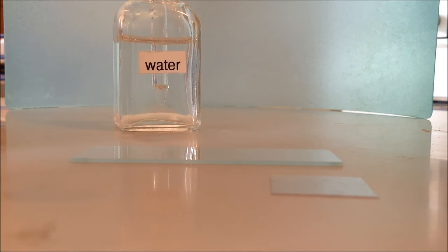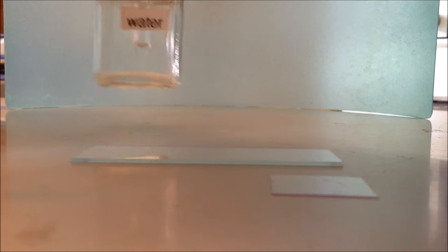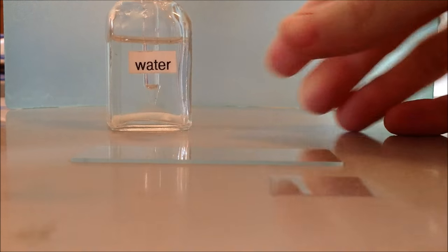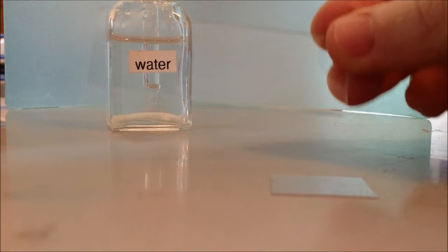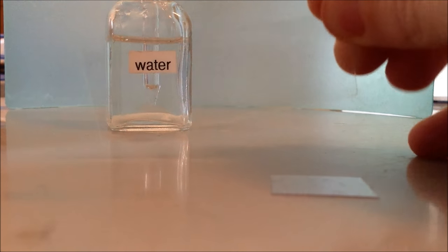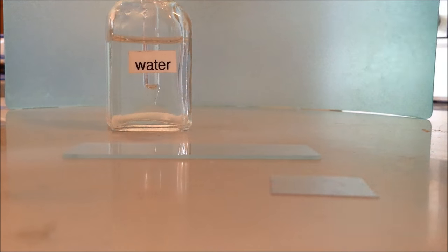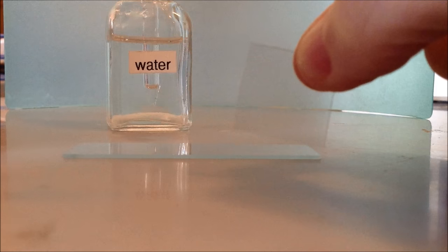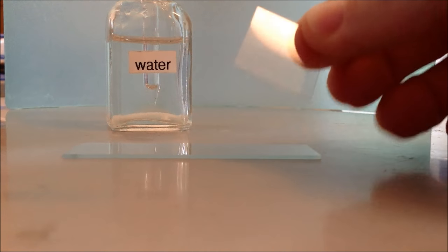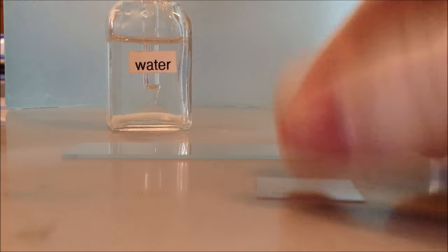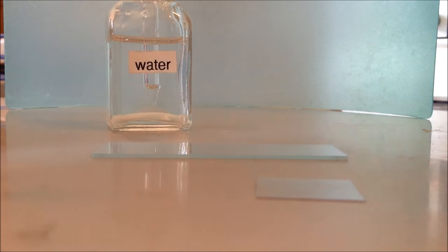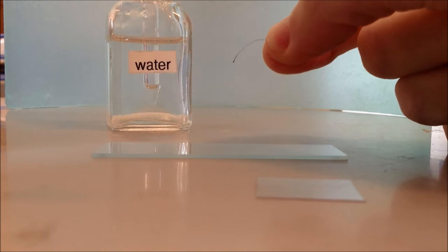So now we're going to show you how to make a wet mount. There's a couple things we need to make sure that this gets done correctly. We're going to need a dropper with water in it, a dropper bottle with water in it. A slide, which is a glass rectangular shape. And then also our cover slip, which is usually plastic or it can be glass and it's just a square thing. And we'll need something that we're going to put on our cover slip. In this case we are going to take just a very small piece of string, like so.